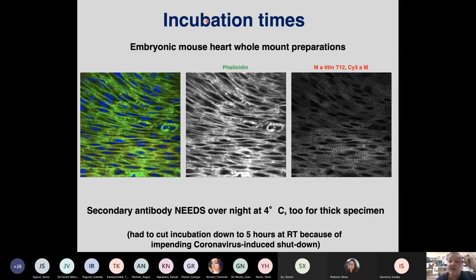Then you have to put your reagents on your stuff, and depending what you're looking at, you have different incubation times. Now, this picture I wouldn't have been able to show to you without COVID. Because this experiment was forced upon me by the impending coronavirus-induced shutdown. So what I often do is stain whole mount preparations of embryonic mouse hearts. So this is 0.2 millimeters of heart. And you bathe it in different antibodies. I usually bathe it in primary antibody at 4 degrees overnight, and in secondary antibody at 4 degrees overnight. But because they were threatening to lock us up, I thought, 5 hours at room temperature may also be okay. Let's try it.